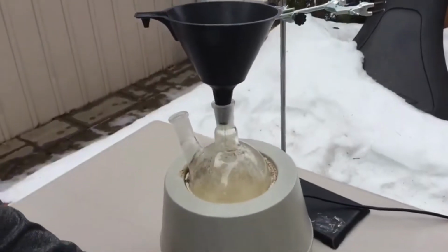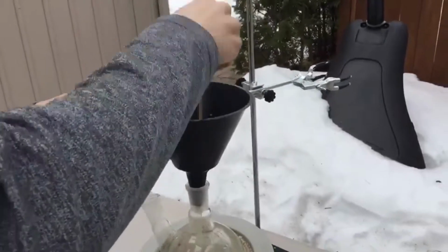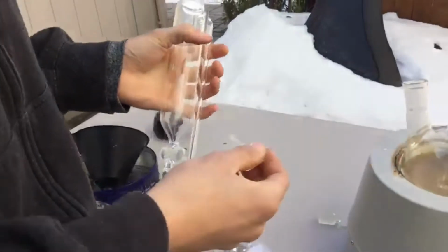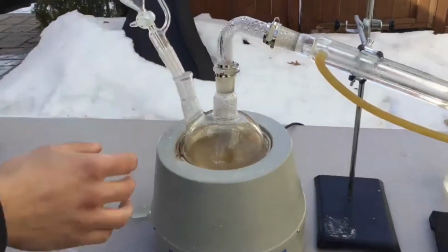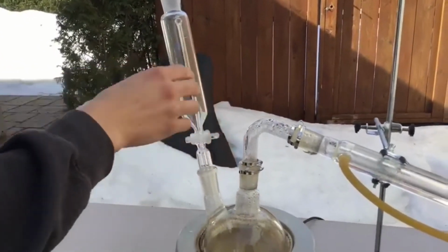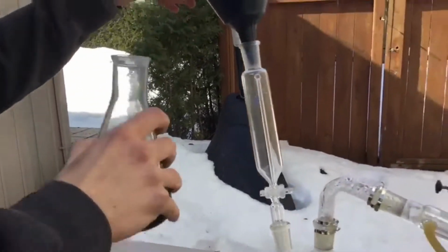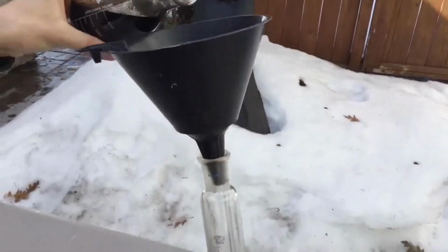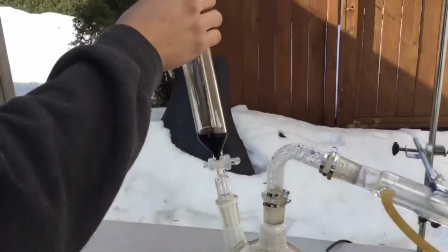I'm going to start up the heating so that way we know that the potassium nitrate will be fully dissolved. Okay guys, so everything is all in solution. It's all dissolved. So I'm going to add the sulfuric acid with this addition funnel. That way the reaction runs nice and smooth. Just make sure everything won't seep through. Okay, we're good.